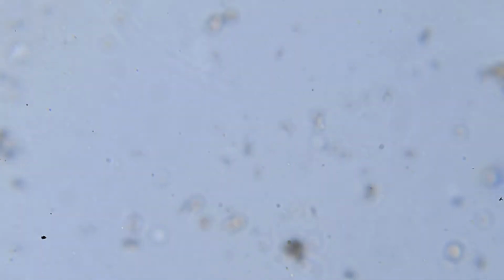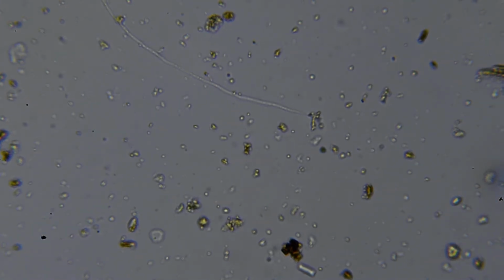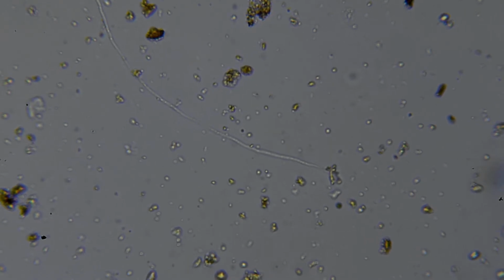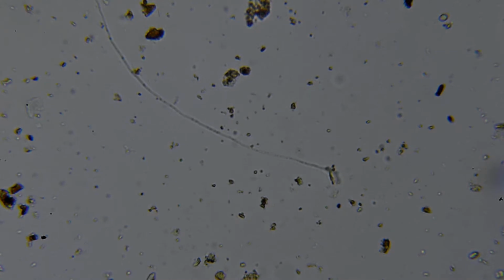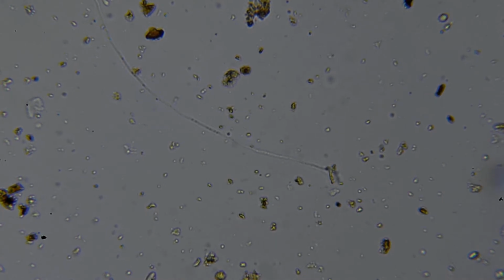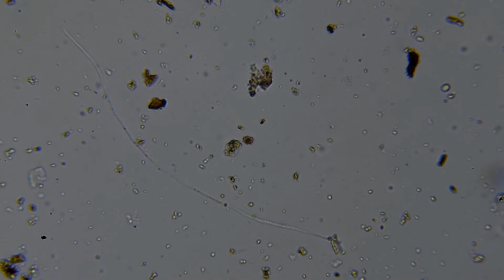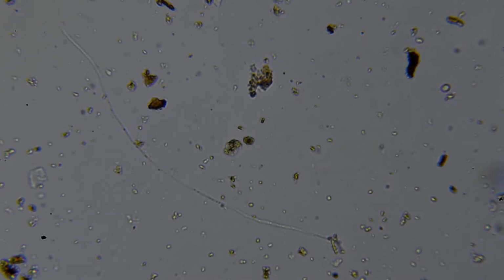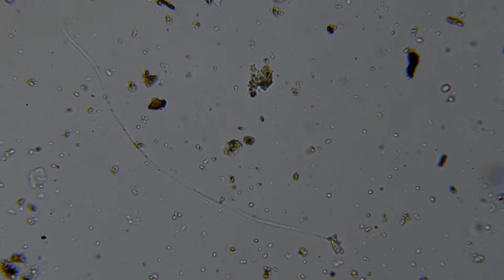So let's just have a little zoom in here. It's going to go out of focus for you. Right. So this is times 400. So this little strand in the center here is one of your actinobacteria pals. There we go. It's a bit refractive, I'm afraid. That's picking up on the camera lens. So yeah, this is a strand of actinobacteria. It's individual bacteria that make a casing for themselves that looks like a hyphae, a fungal hyphae.